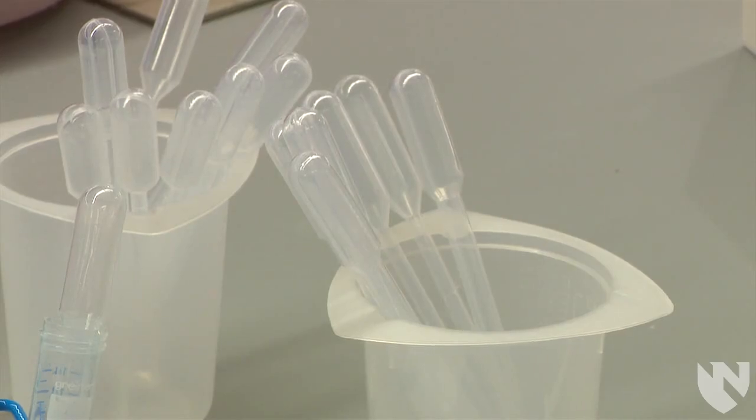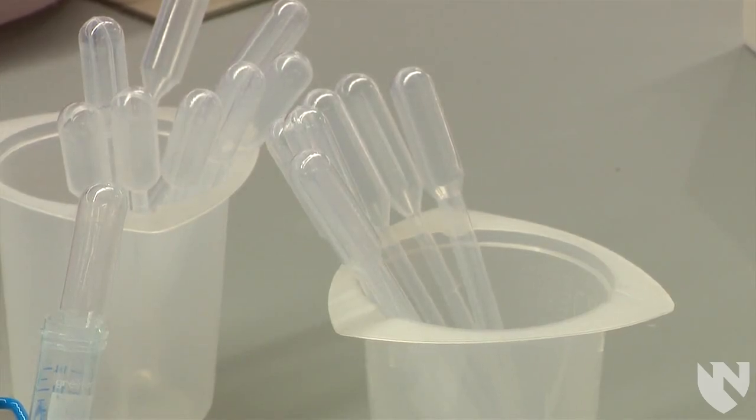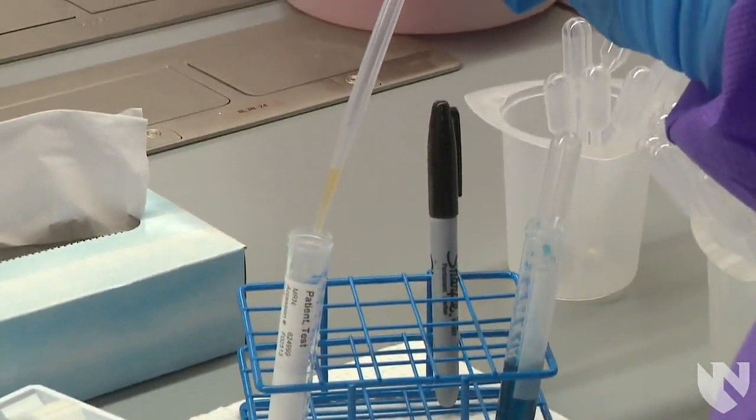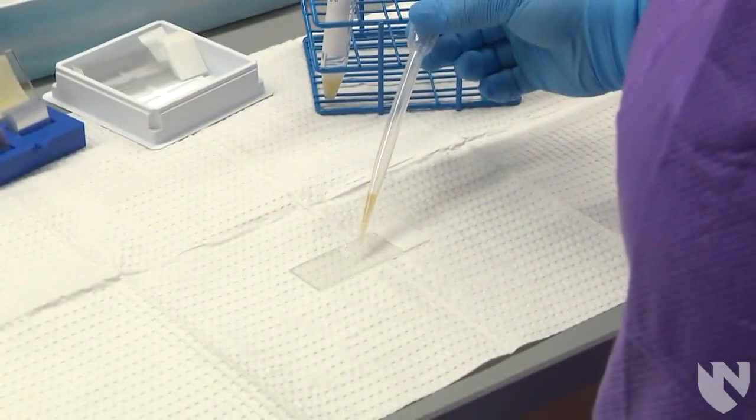Every laboratory is different, so some may use disposable pipettes instead of micropipettes. In this instance, you would take the disposable pipette and aspirate some of the urine sediment.